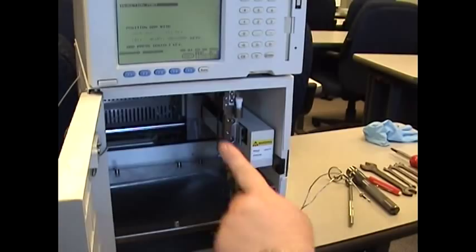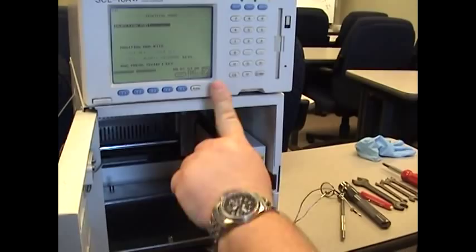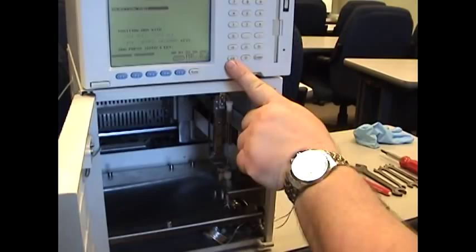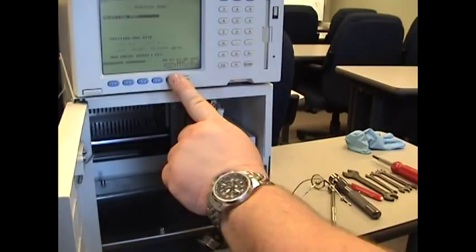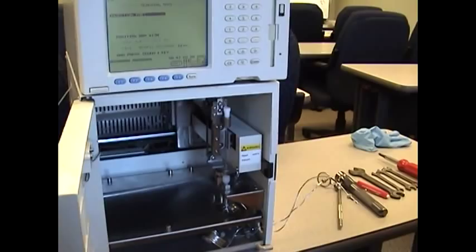What you are doing is you are trying to move the tip of the needle to the top plane of the injection port. You are not recessing it down inside the injection port. You want it to use the very top of the injection port. You can use this with a small piece of paper to help judge the top of that injection port.